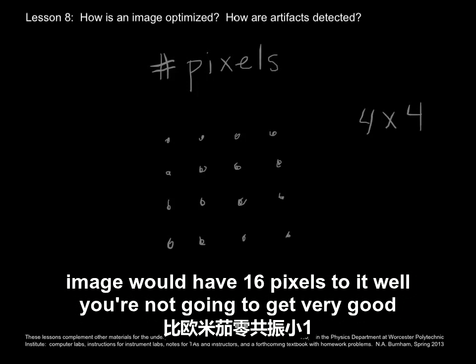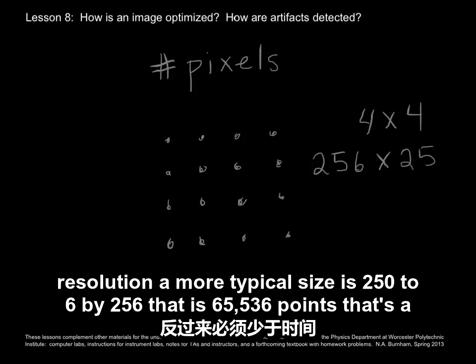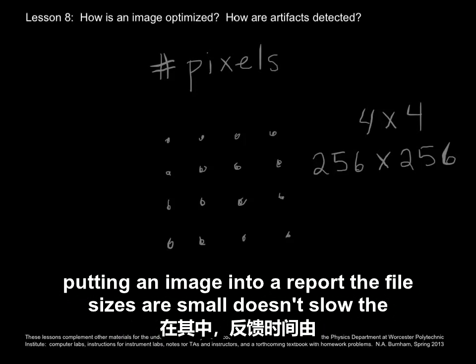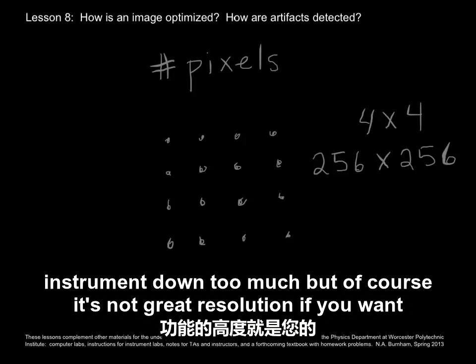Well, you're not going to get very good resolution. A more typical size is 256 by 256. That is 65,536 points. That's a reasonable size for making a postcard or putting an image into a report. The file sizes are small, doesn't slow the instrument down too much, but of course it's not great resolution.